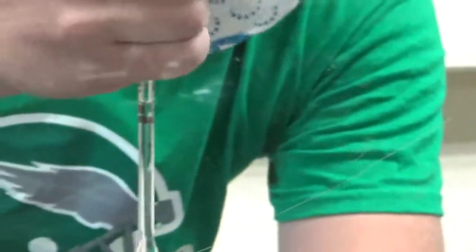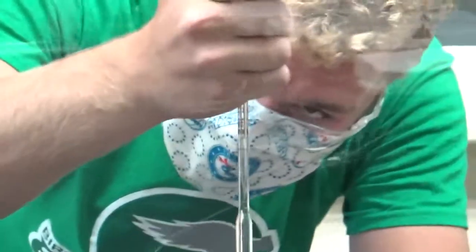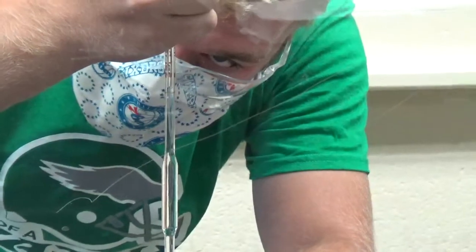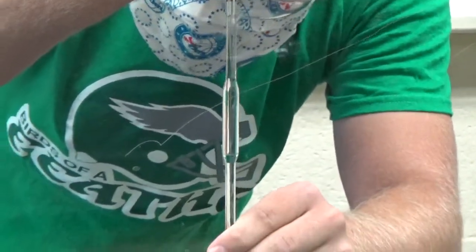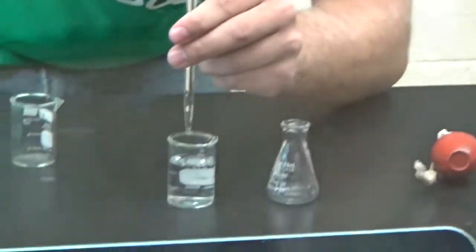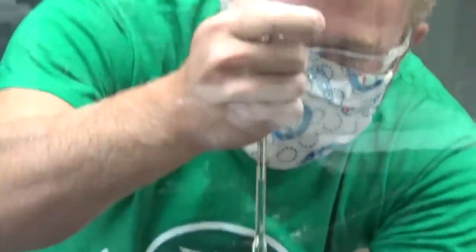You want to draw past the line and then stop it with your finger and then bring it back down to the line. Pipetting takes a little time folks. While he's making that adjustment, I'm just going to reiterate some things. You have the container that you're pipetting from and that bulb that he put on top. Set that there gently. Don't jam it on there.